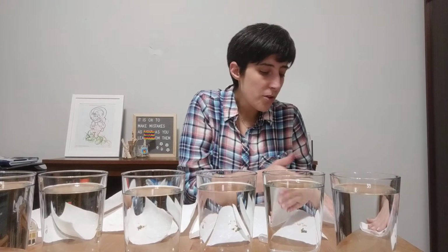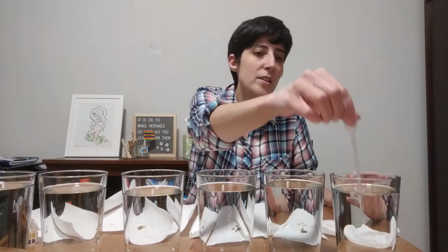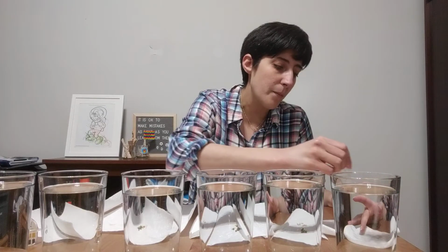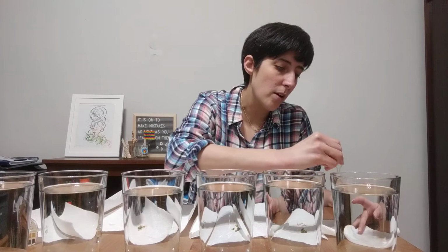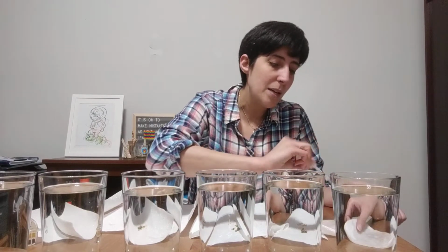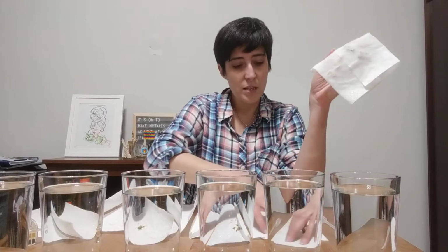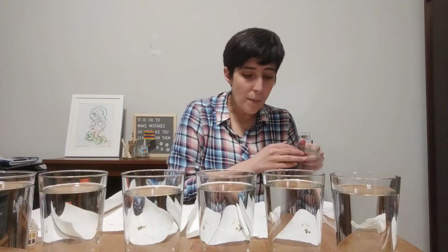I don't want to cover the mung beans. I don't want to overlap mung beans with catgrass seeds. I want to give them each space to germinate. I'm going to go ahead and squirt a little bit more water on top after I folded it. So now I have this little seed packet, and I'm going to go ahead and put that in my 0 ml bag. That means it has 0 mLs of vinegar.